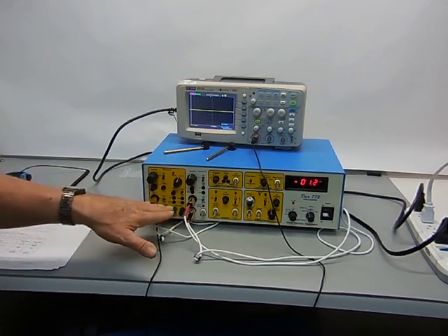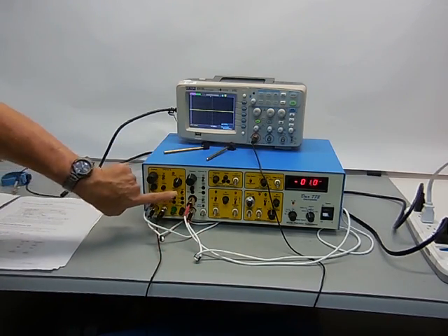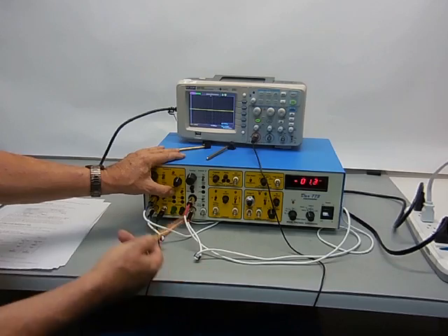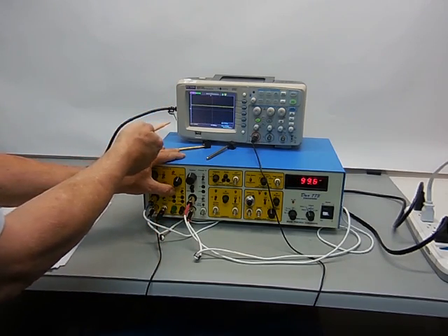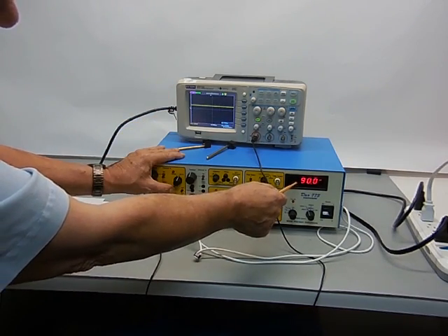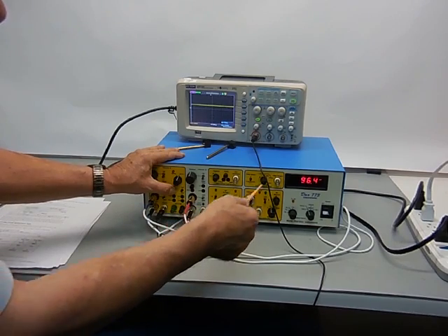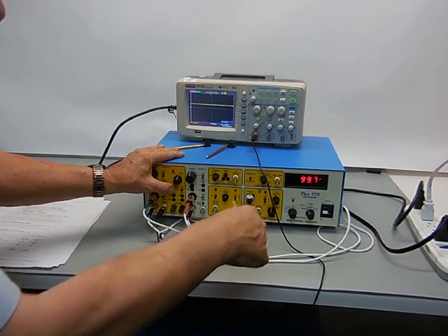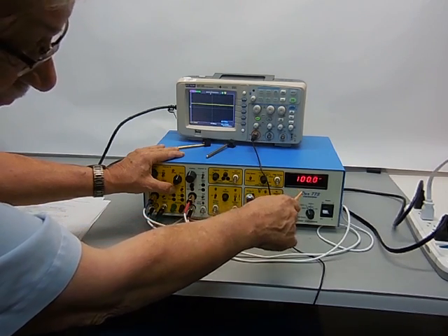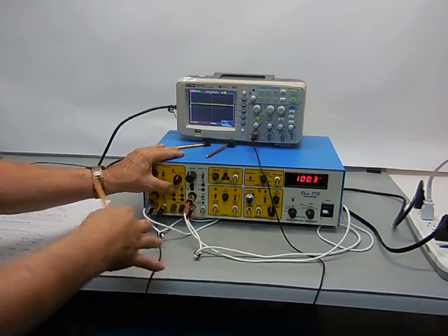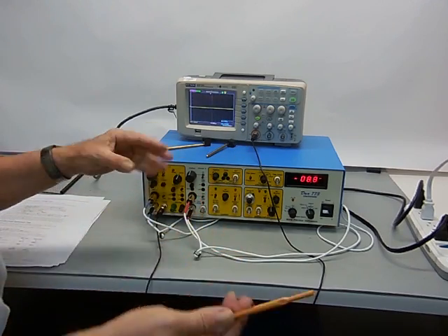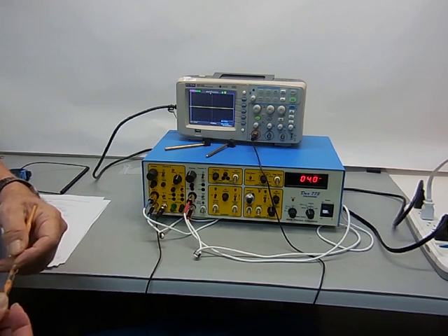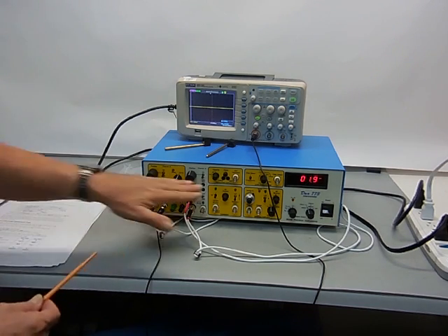The next step is once that's set up, we're going to push the ERT button to test the probe. With this 10 to the 11th resistor, we should see 100 millivolts, and that's what it did. I'm holding it in because it's going to take some time to get there. This is the ERT test. This is for very high, like 15-20 megaohm pipettes to test that.